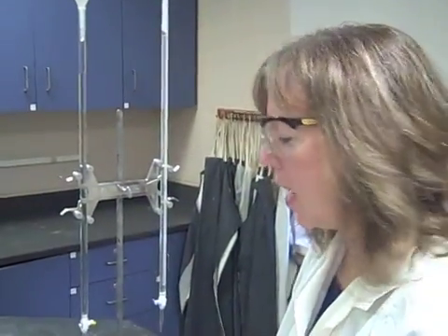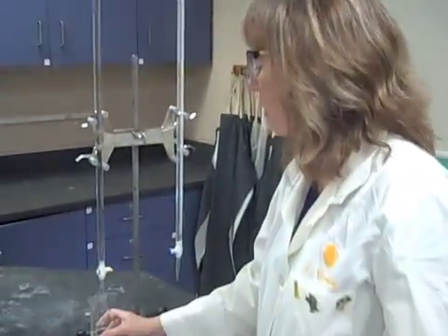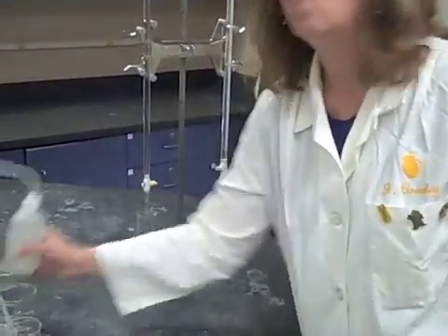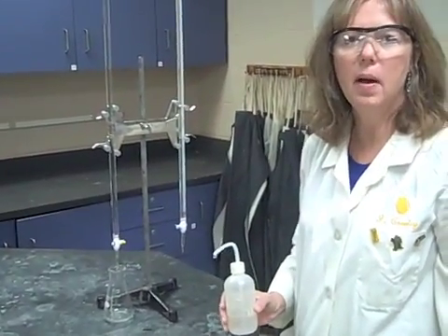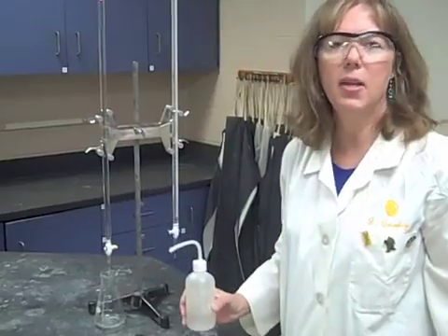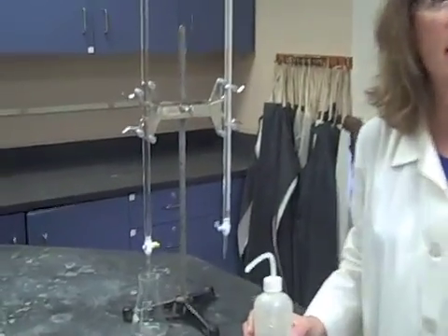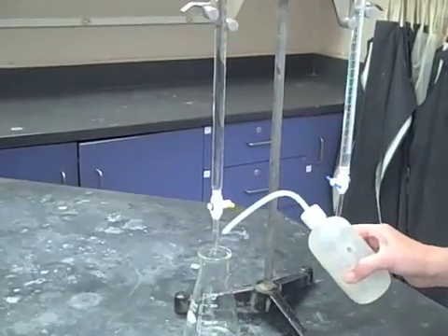The next step, and don't forget this because students tend to forget this, is to go ahead and squirt the bottom tip of that burette to make sure that I got all that acid in that we were supposed to. So I just squirted the end of it.